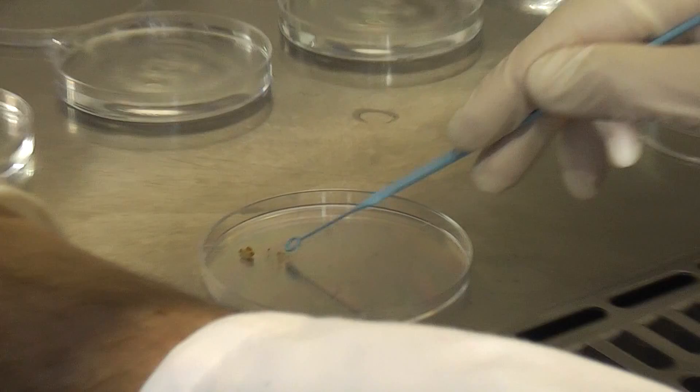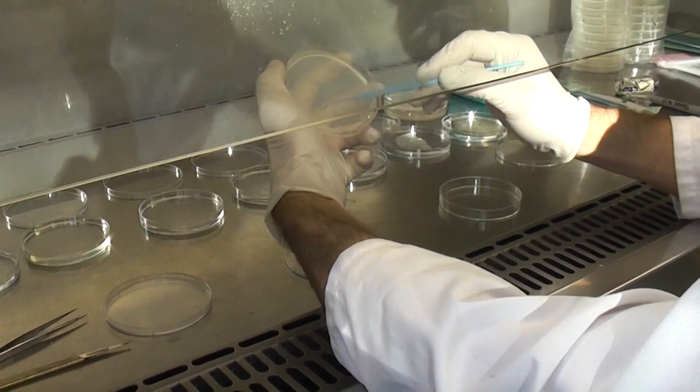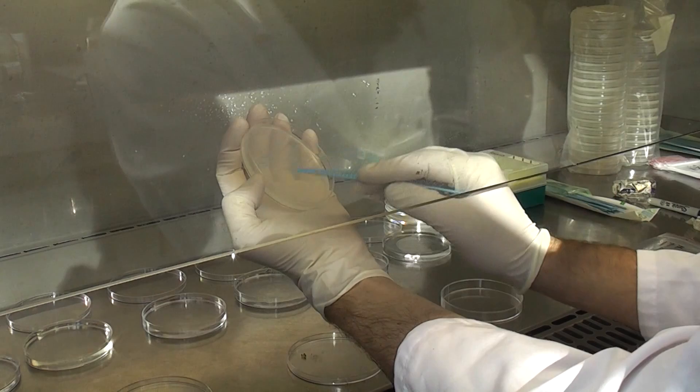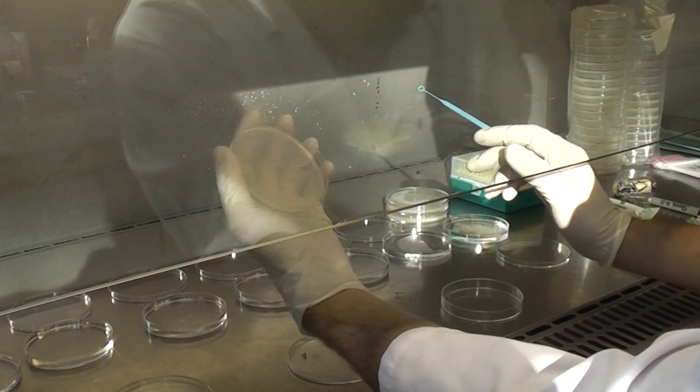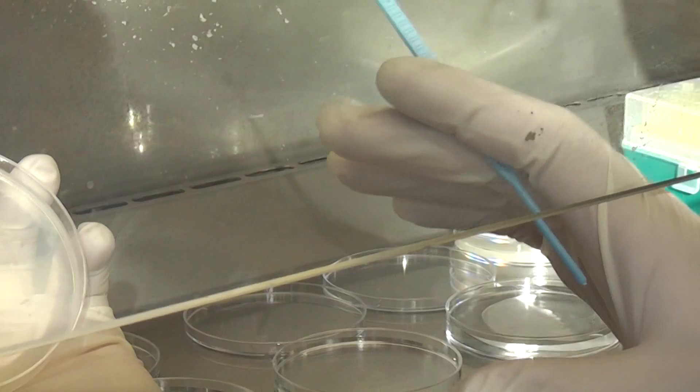And just streak it up the plate like so. Now I did a special pattern there, that's to try and isolate individual colonies of rhizobia.